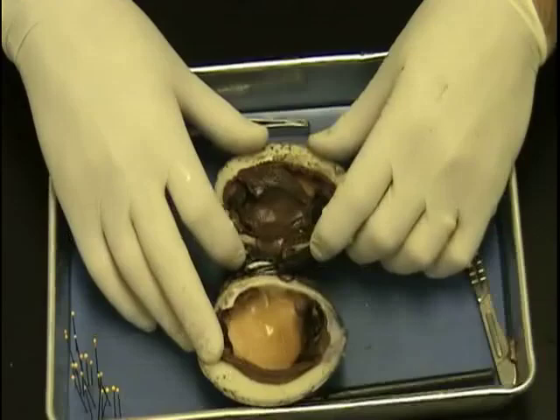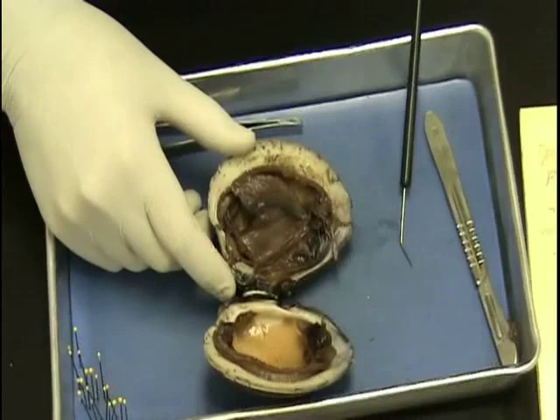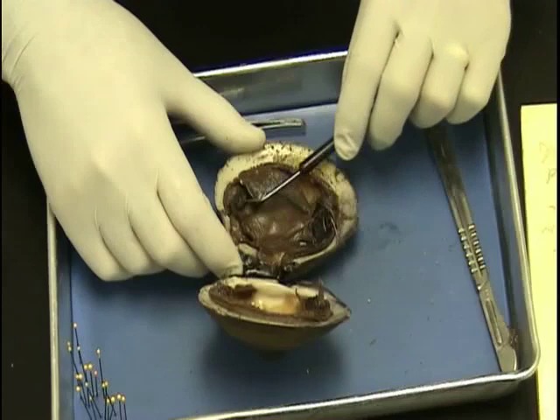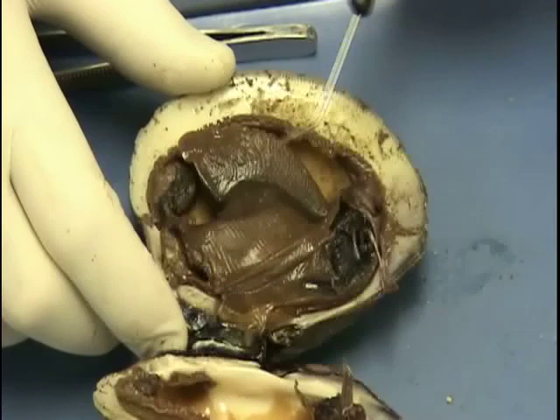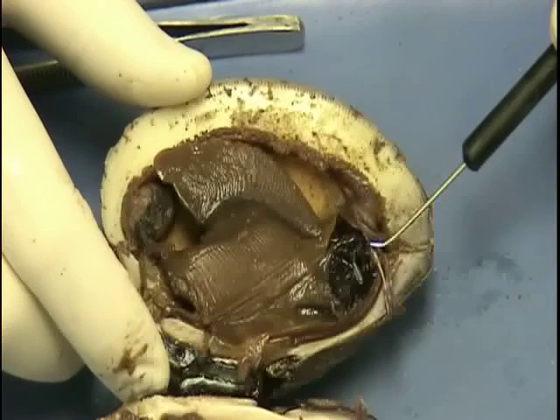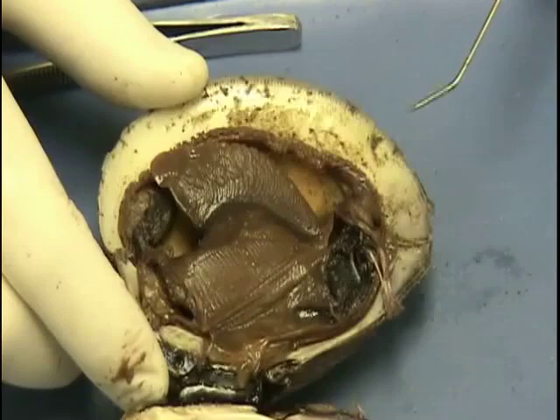Now let's go through some of those anatomical parts. Let's start with the incurrent and excurrent siphons — they're really not exceptionally visible here on these specimens. But you've got your incurrent siphon right here; see this little indentation? The water comes in through the incurrent siphon, it goes over the gills. Here are the gills right here. The gills have cilia and mucus on them, and as the water moves in, the mucus collects all the little tiny pieces of detritus, microorganisms, and sand. You can see on top of here there's some of the detritus that it's feeding on. It will come out through the excurrent siphon right here — there are usually some tubes that kind of come out. So: incurrent siphon, over the top of the gills, then excurrent siphon.